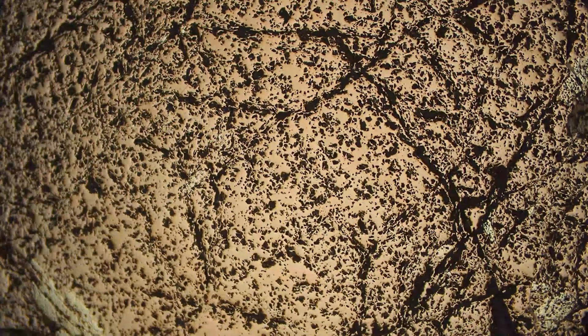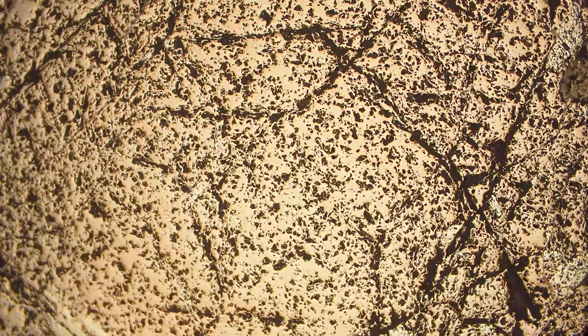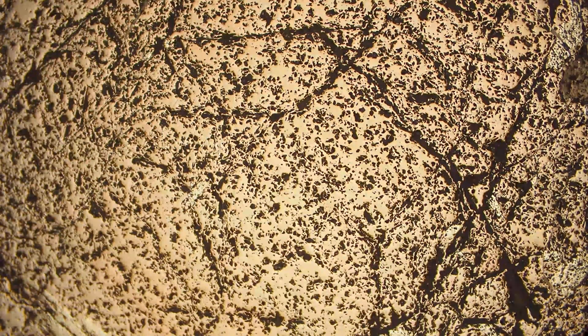If we switch over to cross polars and start rotating the stage, we can see that there's no change in brightness — nothing is really getting through. This means that it is not anisotropic, or in other words, it's isotropic. Occasionally there might be slight anomalous anisotropism, but that's not the case in this sample.